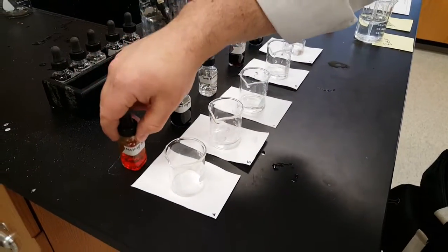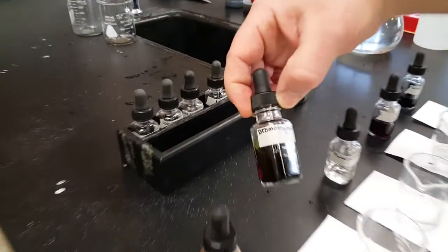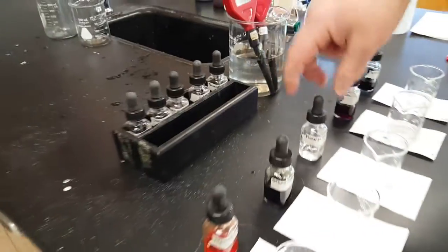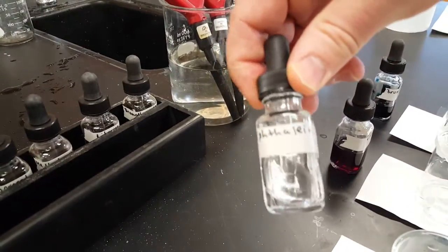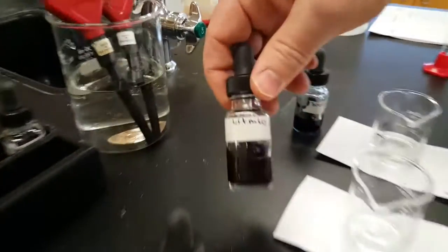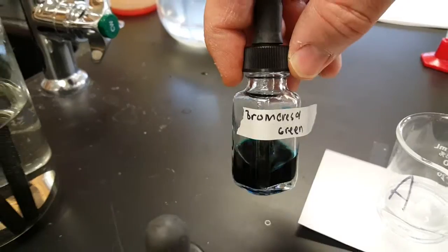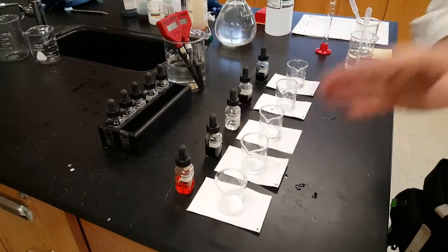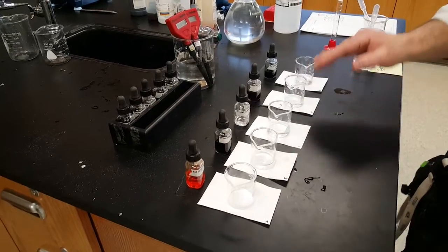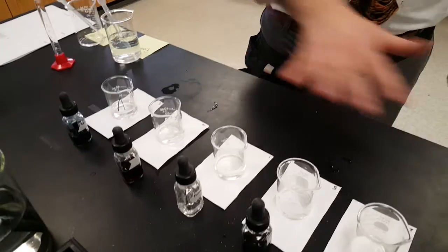The first one you want to test is methyl orange, so put it close by. Second one, bromothymol blue. It's in the list of your data in the lab. Third one, phenolphthalein. Fourth one, litmus. Fifth one, bromocresol green. Make sure those labels stay on. Now, don't do these one at a time. Set them all up so you can do all five in a row so that this takes less time.